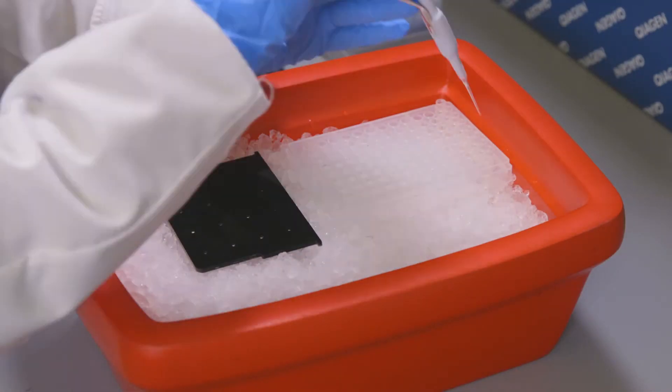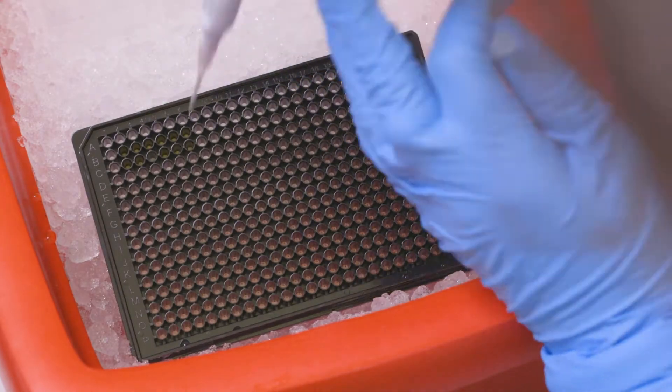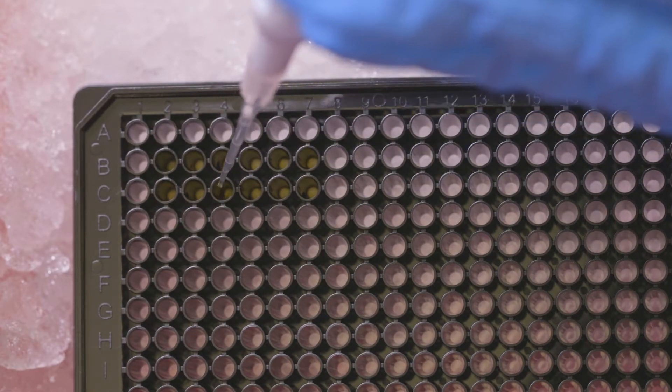Next, we apply the cell-free solution to the paper disks. The solution contains DNA encoded with our toehold switch sensors, as well as protein synthesis components.